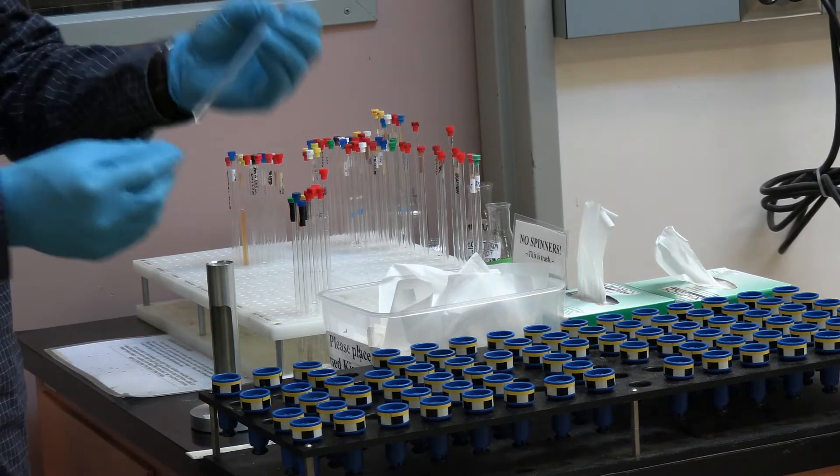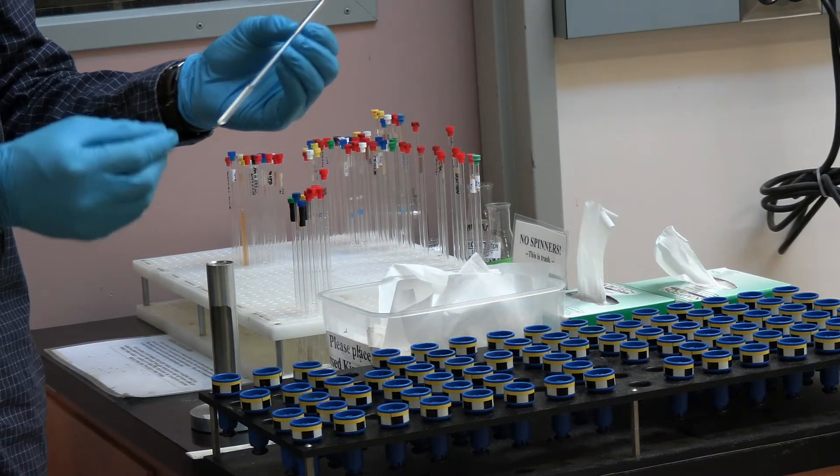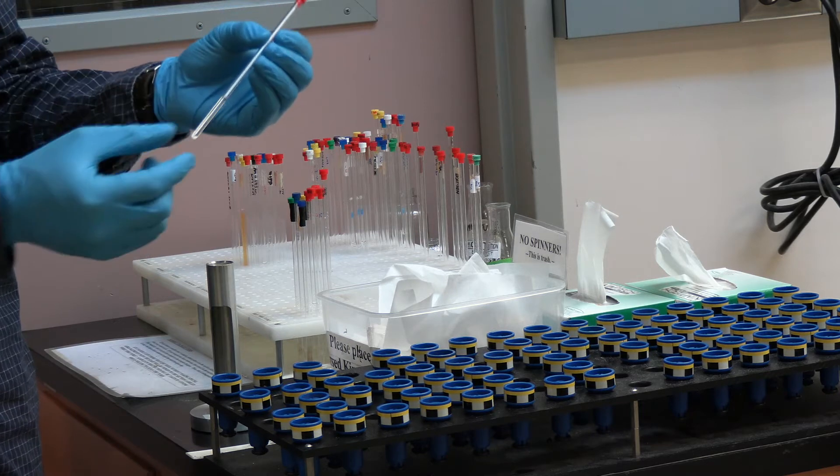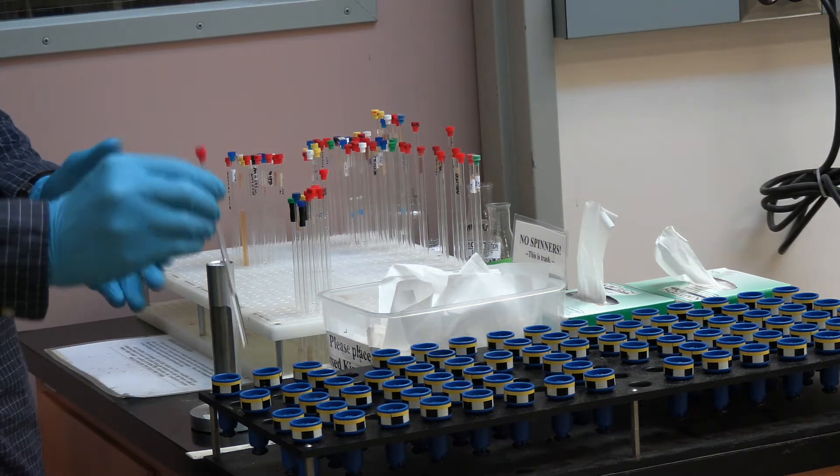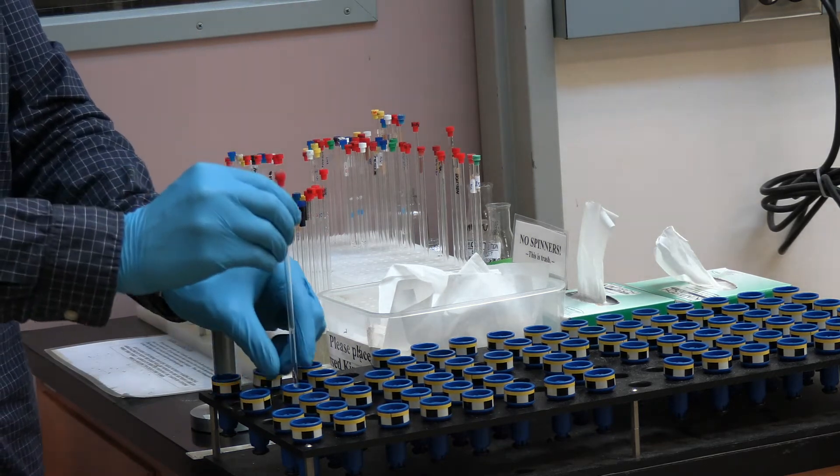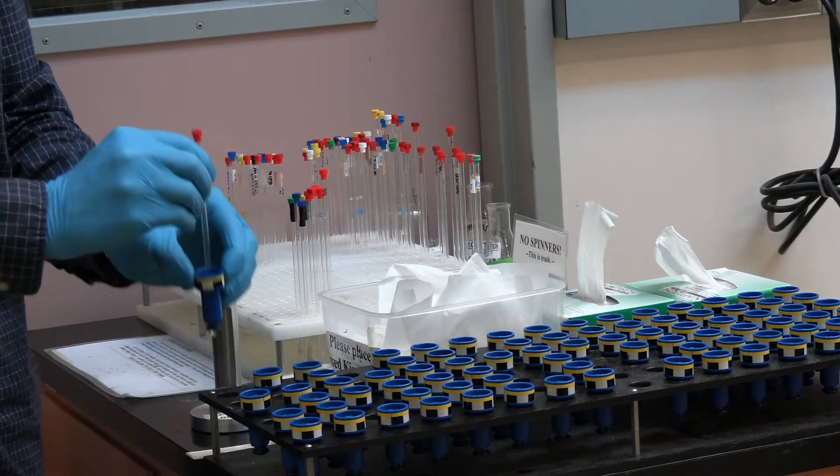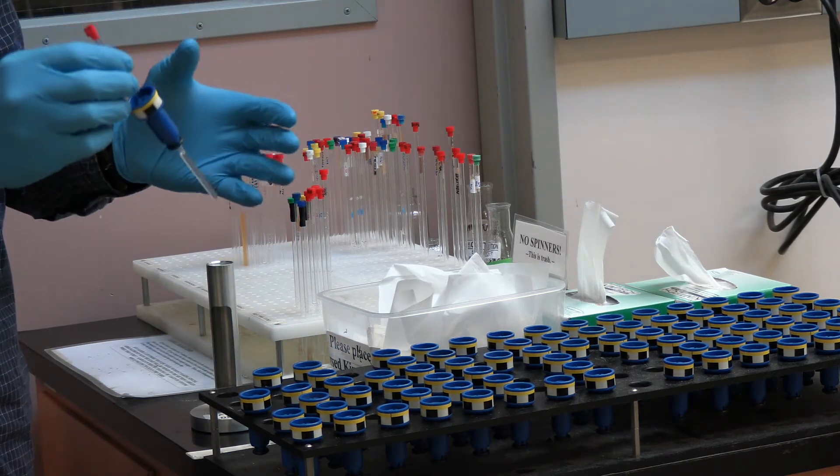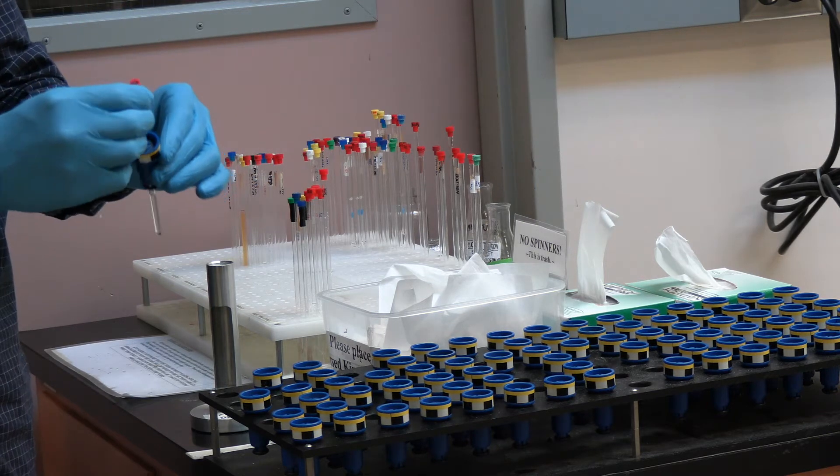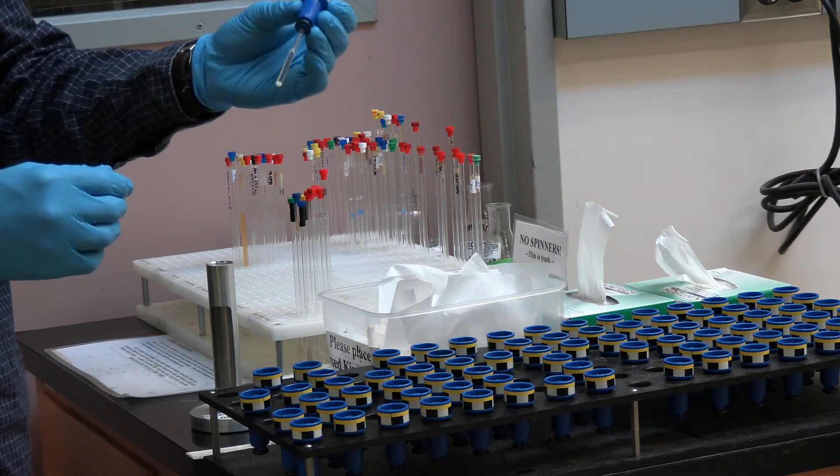Now each spinner varies slightly with how tightly it will hold each tube. These differences along with small variations in the NMR tube diameter give each spinner a unique fit for your sample. So when choosing a spinner it is important to shop around and find a spinner that will hold your tube just right.